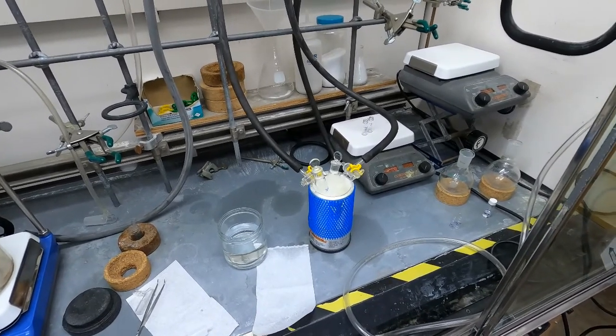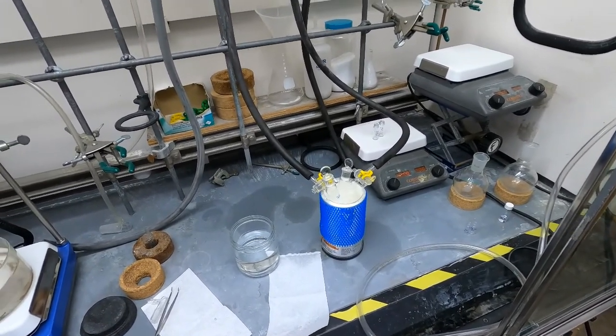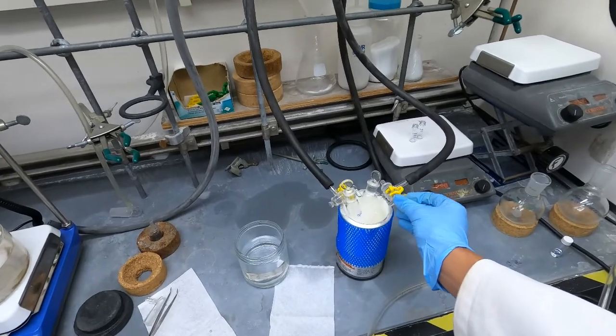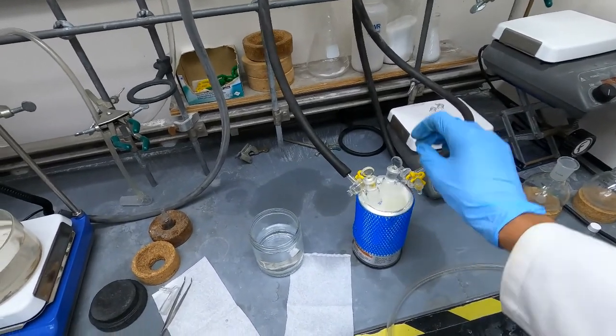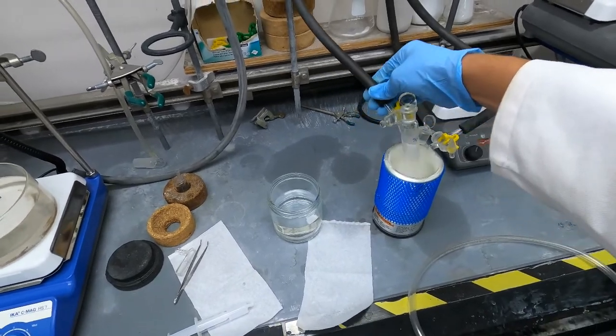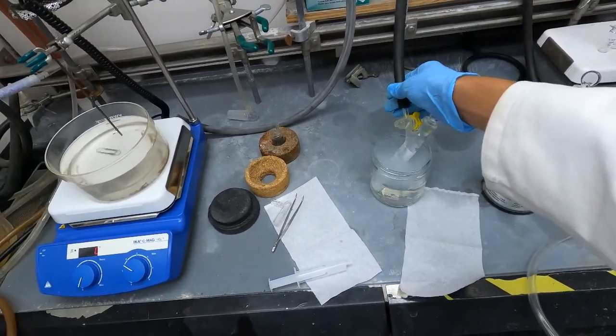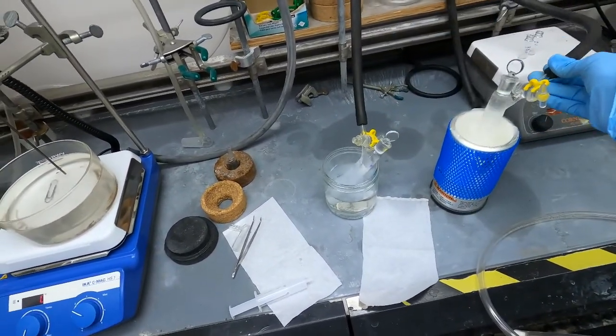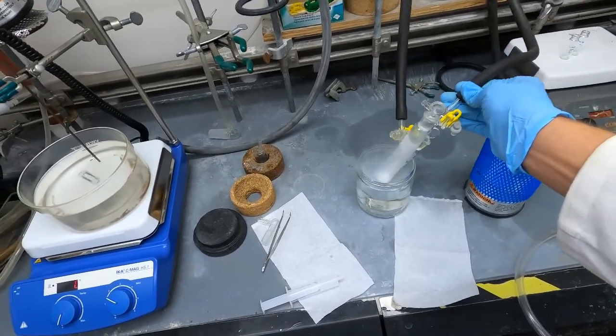These tubes have been five minutes under vacuum so now we are going to close them off to the vacuum and then transfer them from the liquid nitrogen to a water bath so that they can thaw.